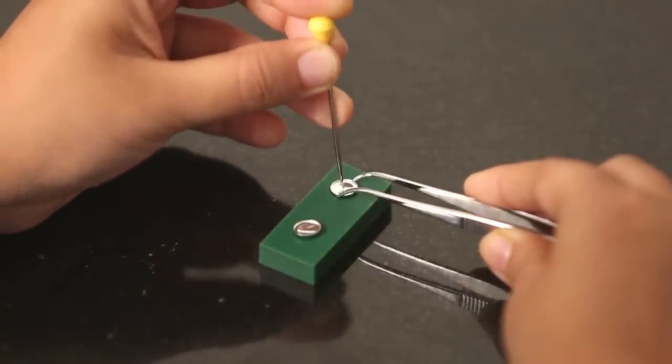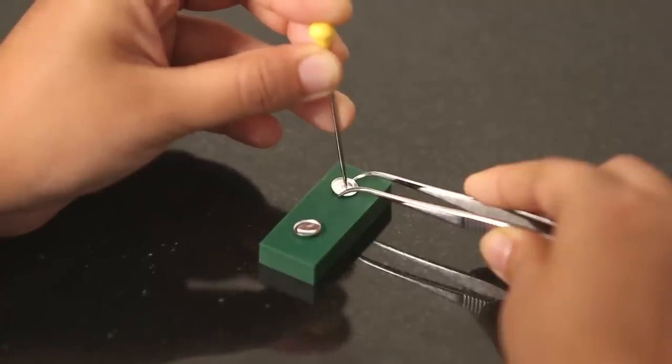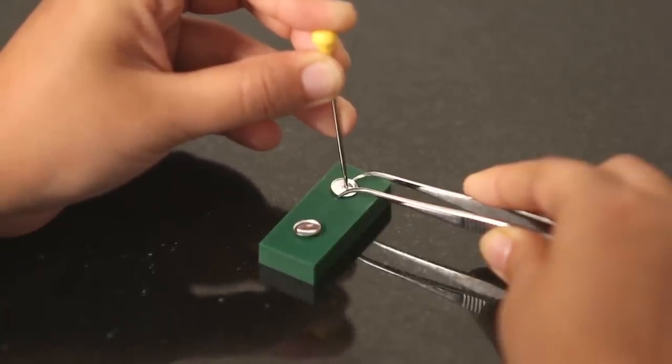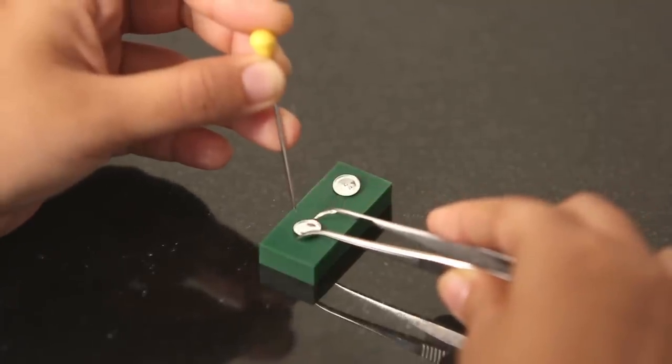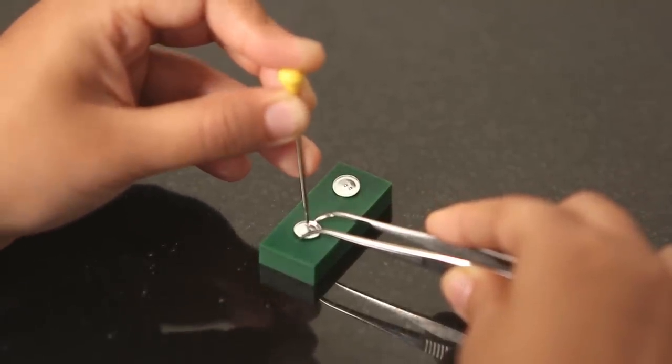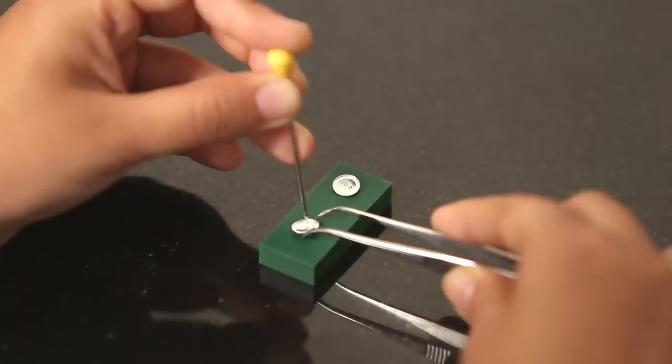Pierce the reference lid with two holes, and the sample lid with one hole by placing them on the eraser and using the standard needle from the crucible box.